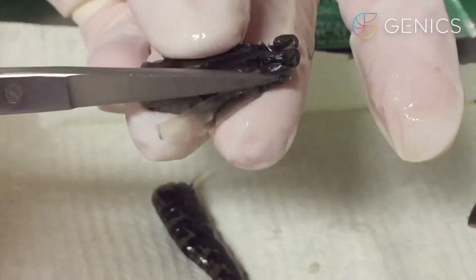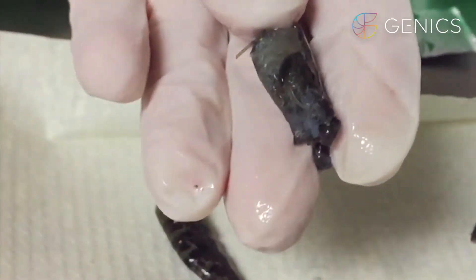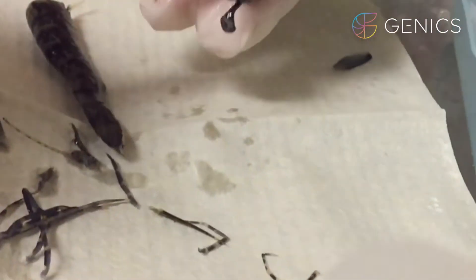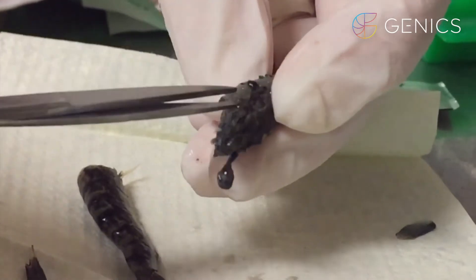Next, we cut just to the right-hand side of the central line and remove the carapace, pushing up with the scissors as we go. We do not want to interrupt the organs on the other side of the shrimp, because we want these for deep-dive histopathology.